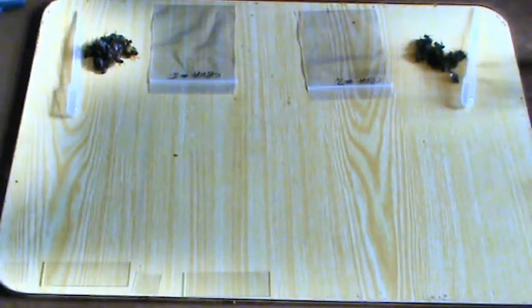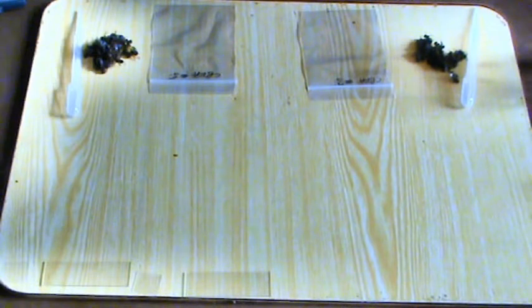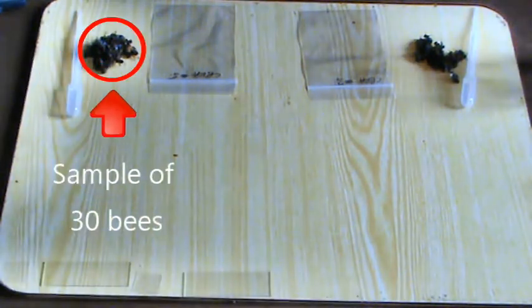What we're going to do now is show you how to prepare a sample of bees for Nosema testing. I've got all the kit around me.